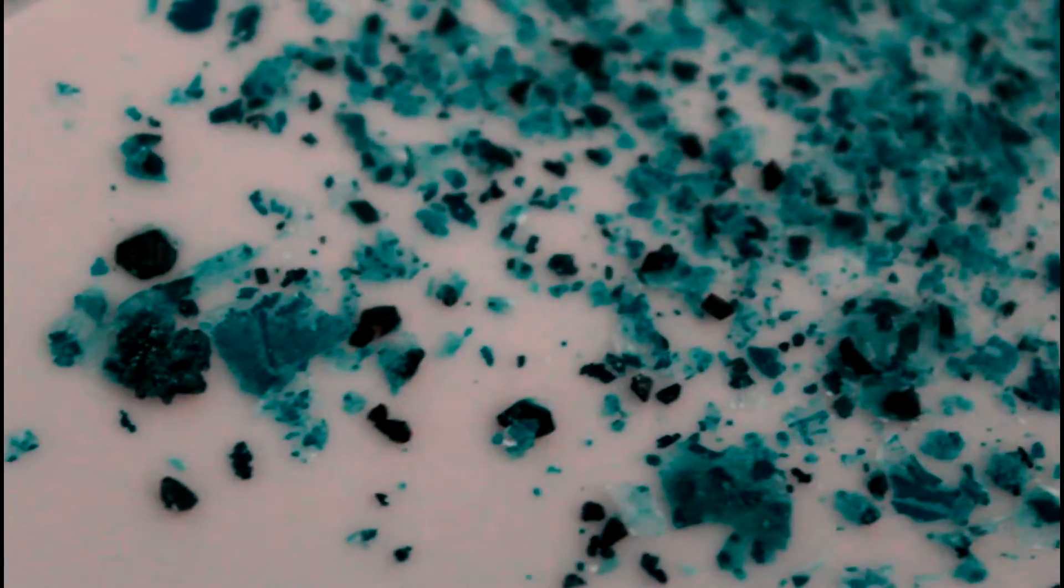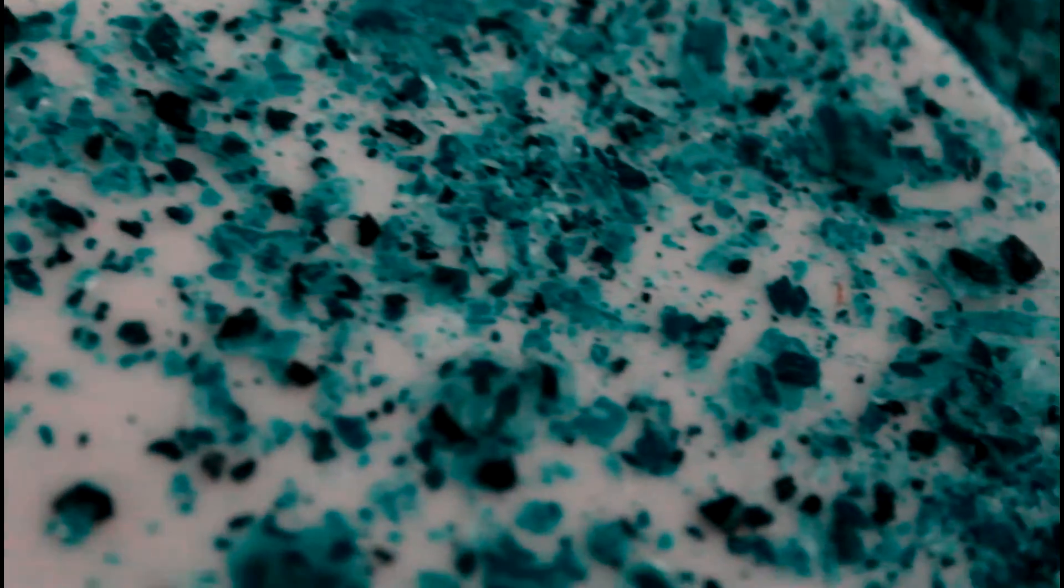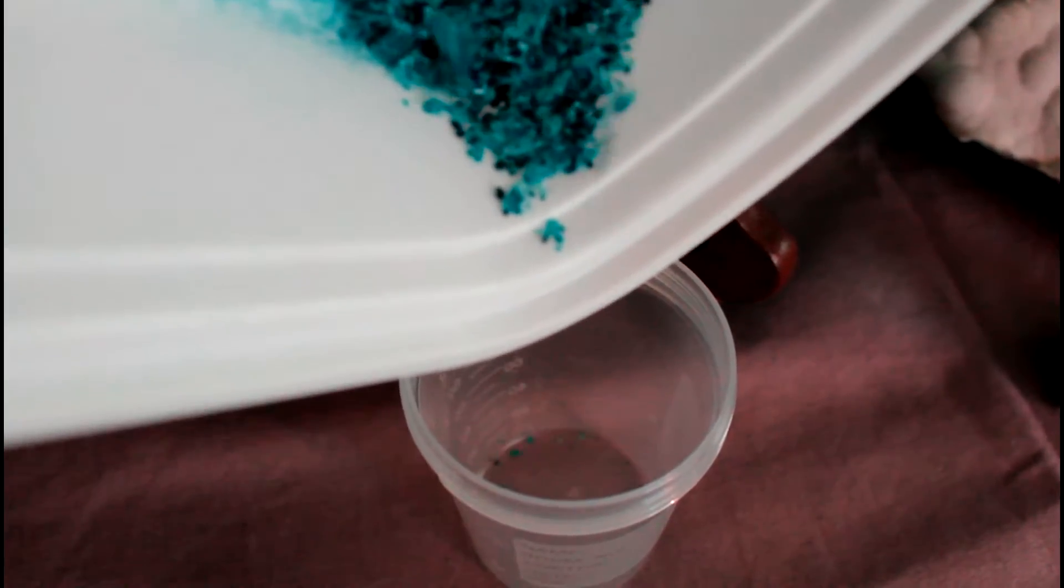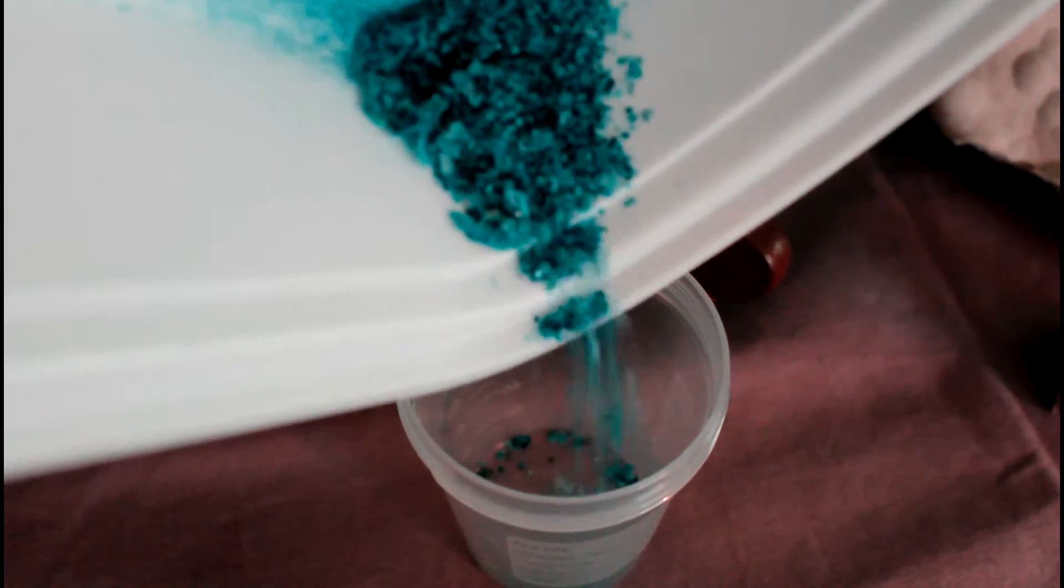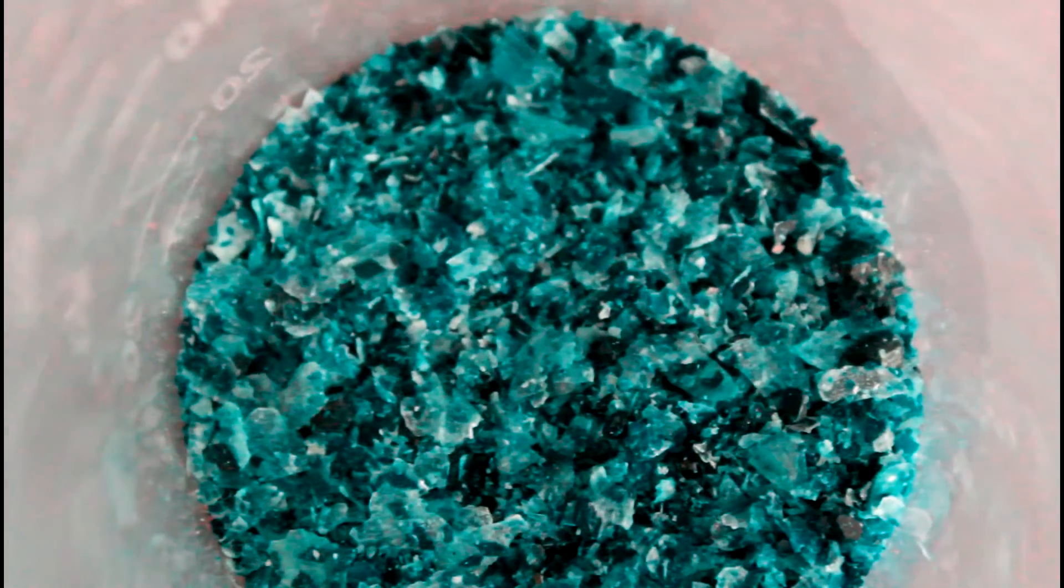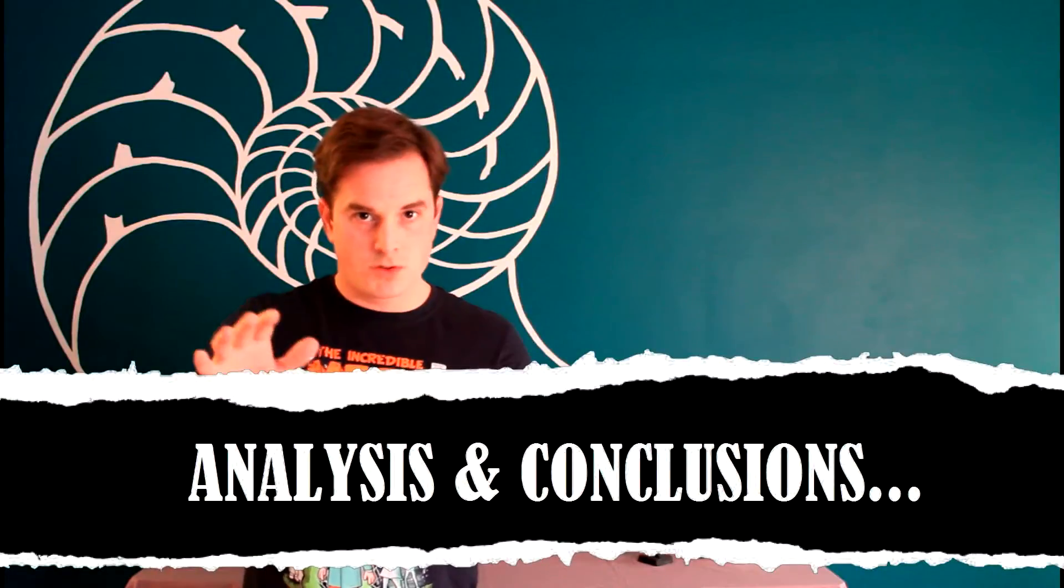After a couple more days of doing this, my dish fully dried and now I had relatively pure copper 2 acetate crystals. How cool is it to know that all of that blue color is from copper ions, copper atoms that used to be part of your pennies. And now if you want to, you can collect these and put them in that small container. And I recommend doing that. We're going to do some future IndyLabs with this chemical.